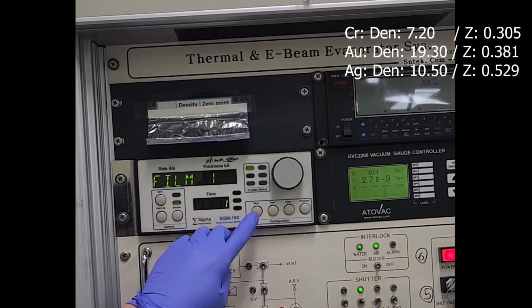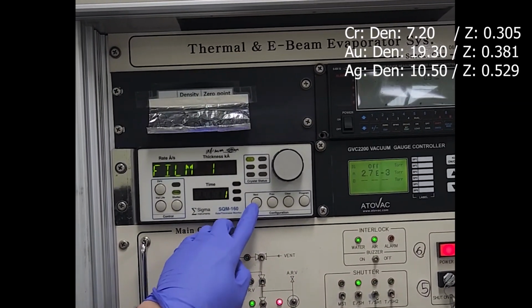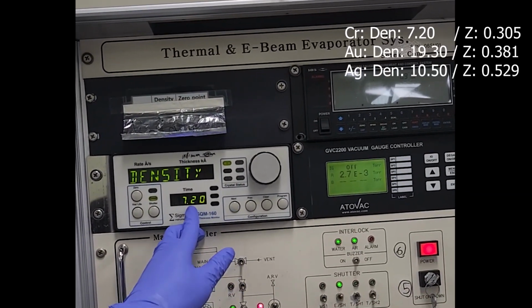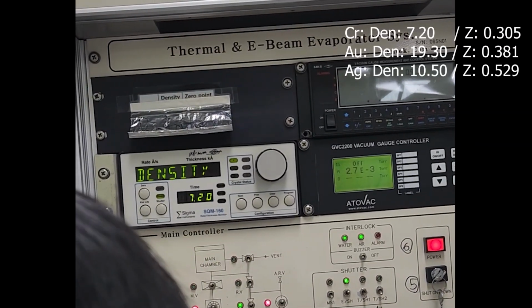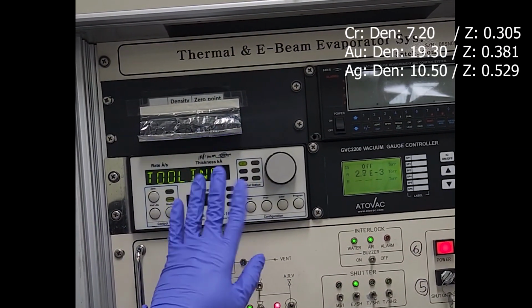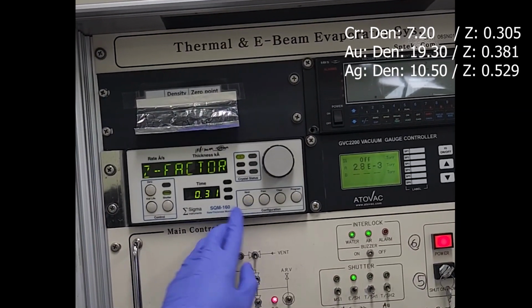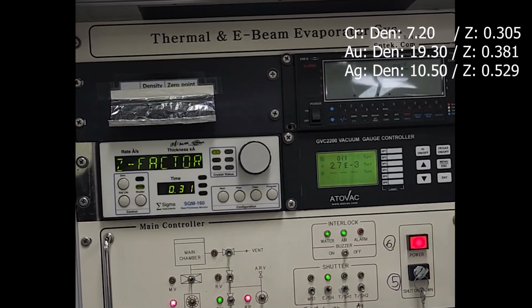And check the information. Click next. Density. This is density 7.2. Okay, next, and Z factor 0.31.